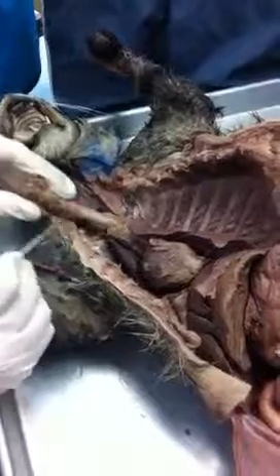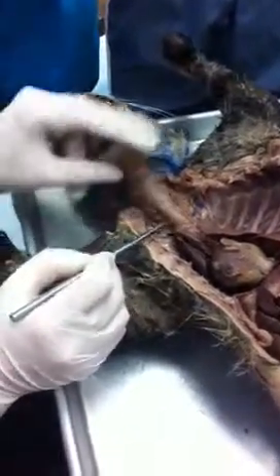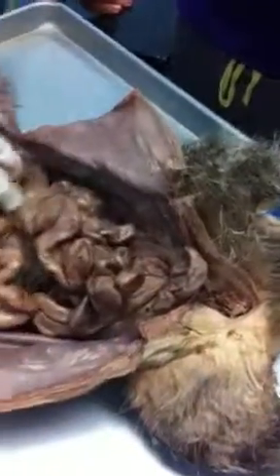Okay. What is this again? Trachea. What are the C rings made up of? Hyaline cartilage. Excellent. What's the lining here called? Parietal pleura. What's this right here? Urinary bladder. Okay.